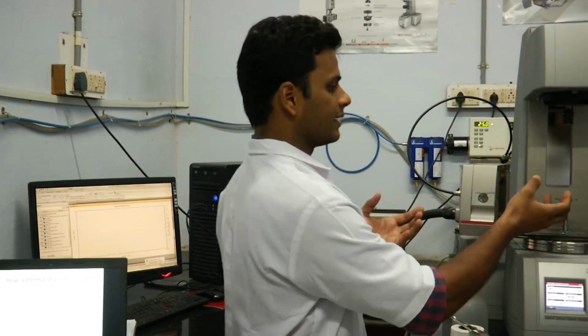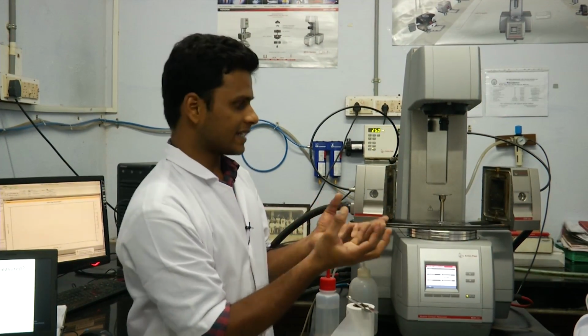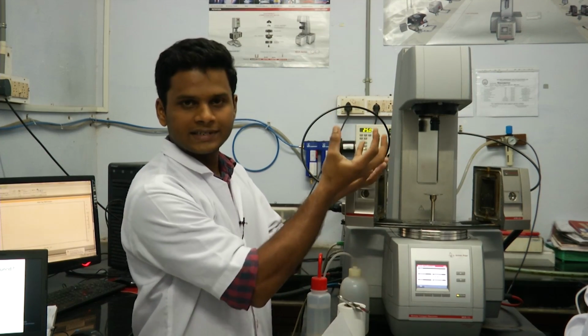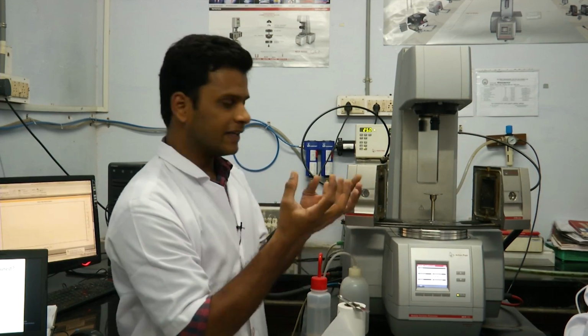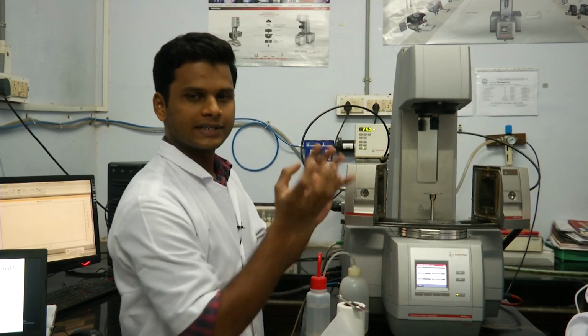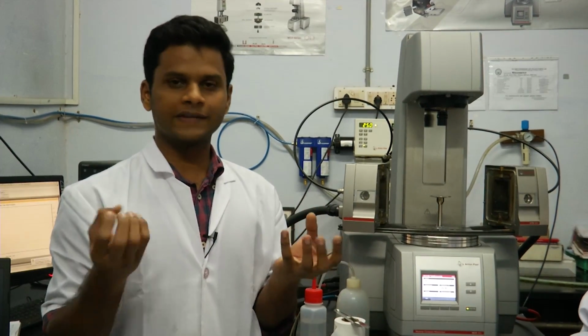So in this rheometer, whenever a thrust is exerted onto the top geometry, the force that is detected is positive, which means whenever a sample expands or pushes the top geometry, the force that is developed is a positive value, and whenever the sample shrinks or pulls the geometry towards the bottom plate, the value is negative.